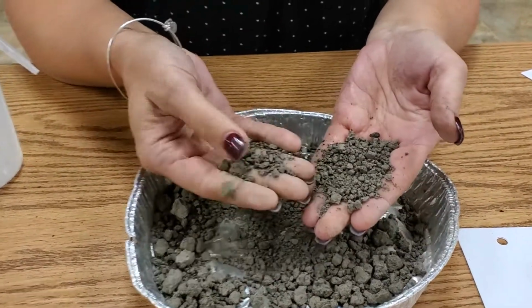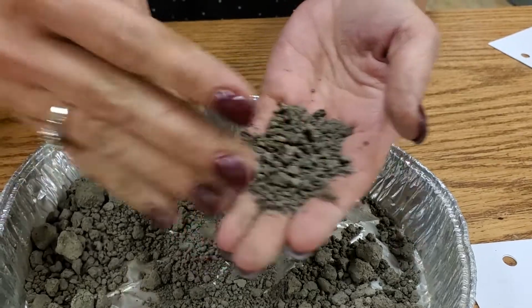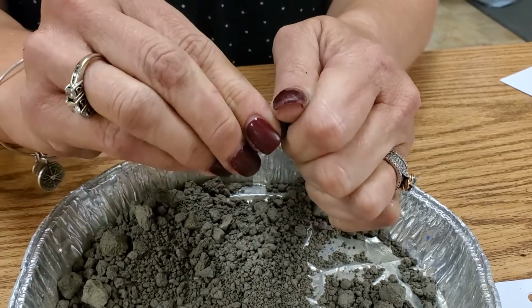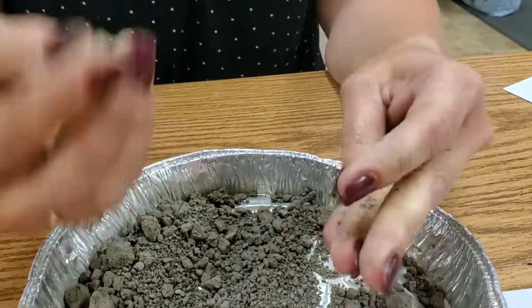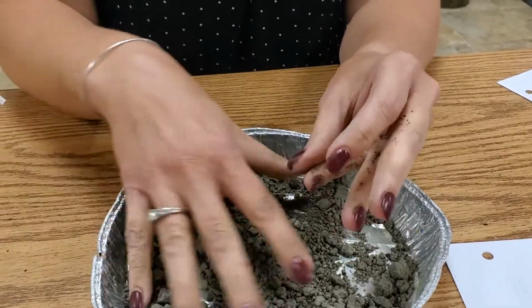Color does play a big part in things, and we're going to use the Munsell colored charts next time. I'll walk through this. You can see that these are in peds, so to say, and these peds are so hard to break. That took quite a bit of strength, believe it or not, and I can't really break that down much further. That will tell you what kind of soil it is off the bat. But I'm going to see if I can walk through this process. Hopefully these peds aren't too hard.